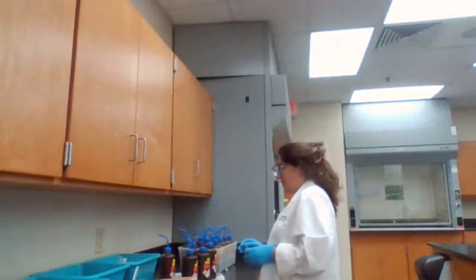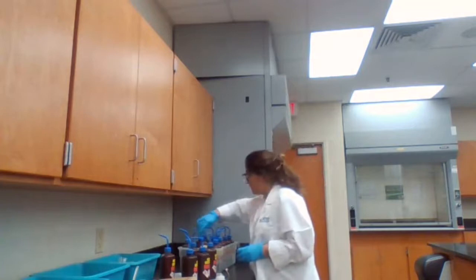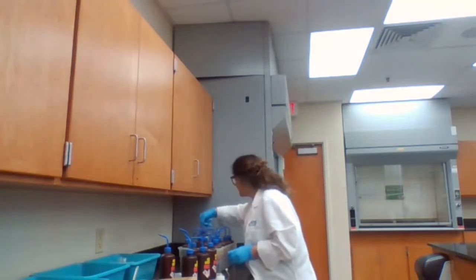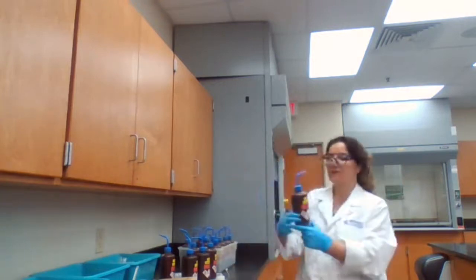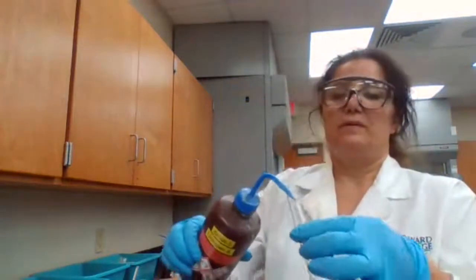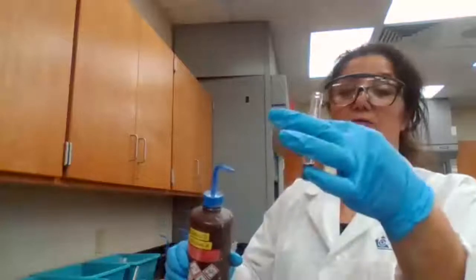Okay, we are looking for unknown, group 3 unknown. Let's see that unknown group 3 definitely is here. Okay. Just the unknown A. Group 3, 10 drops. Follow the procedure.